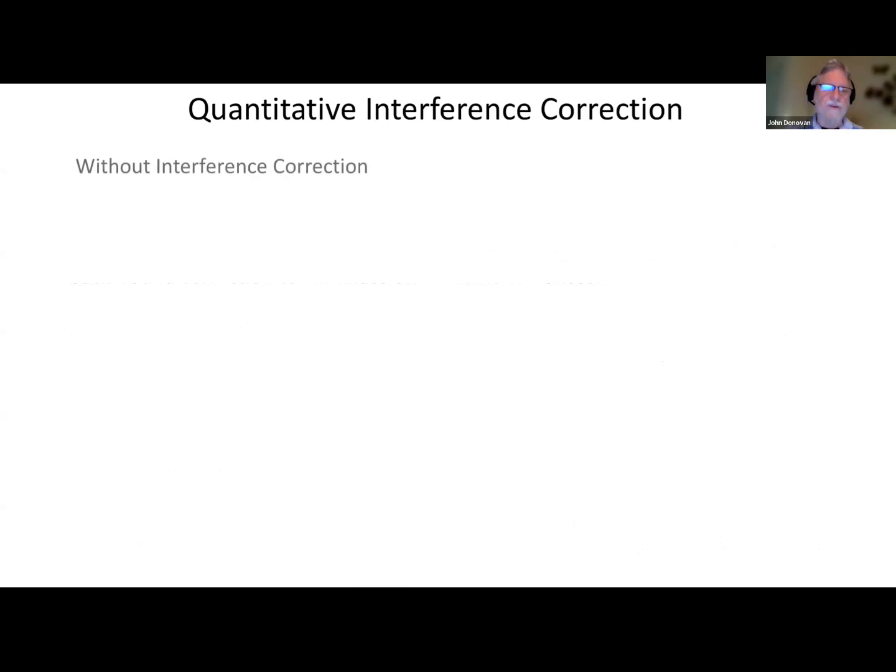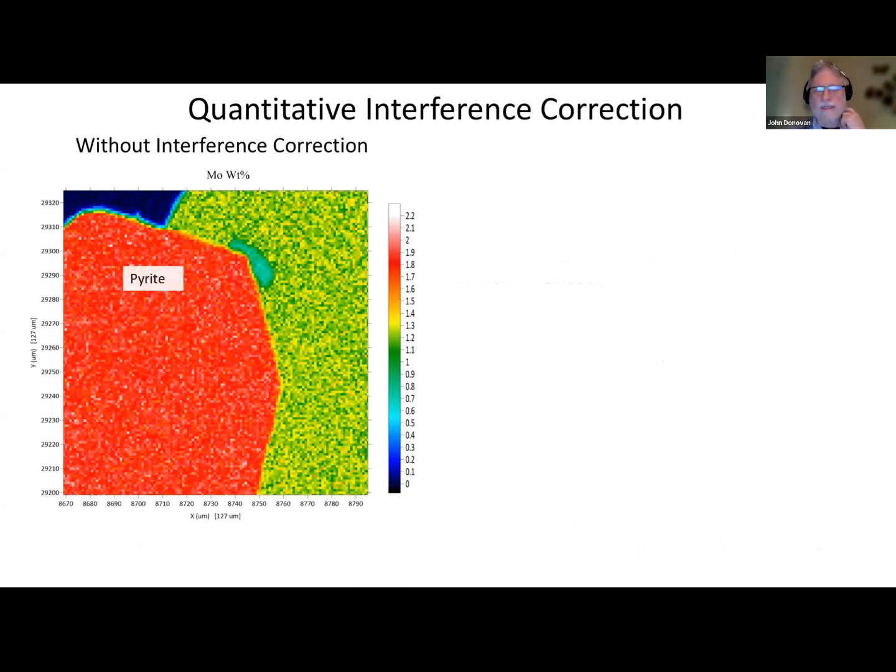Okay, so here's the interference correction. I'm just going to go over this really quickly. This is an example. I just like this example. We're measuring molybdenum in pyrite and in chalcopyrite, and we're getting a nominal concentration of molybdenum here of about 1.9 weight percent. This is in weight percent here. And in the chalcopyrite, we're getting about 1.2. Okay, that's without the interference correction.